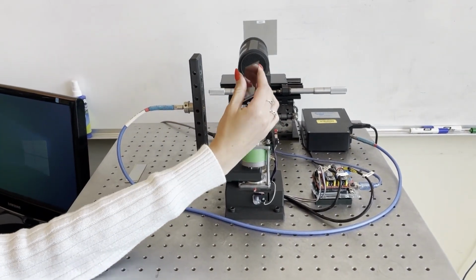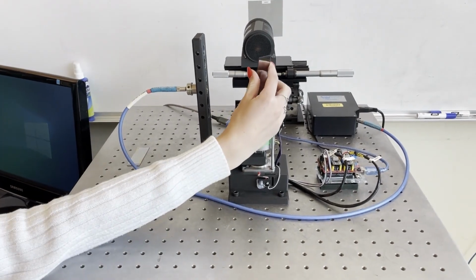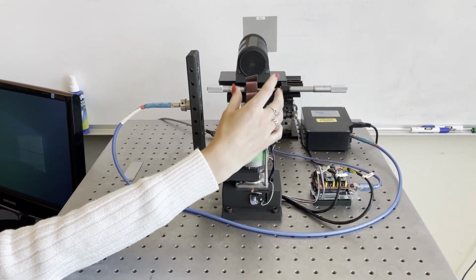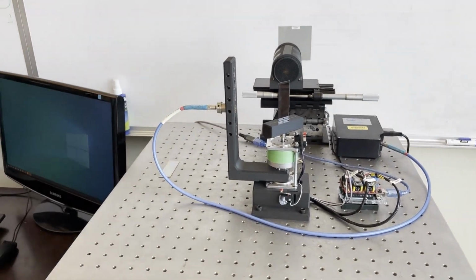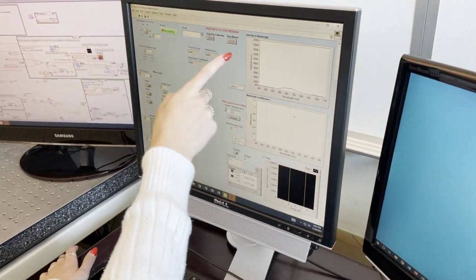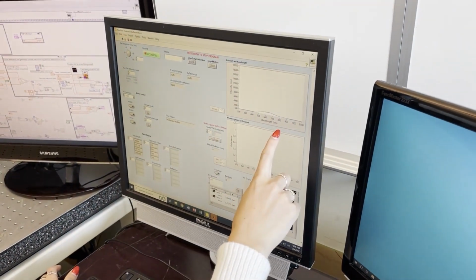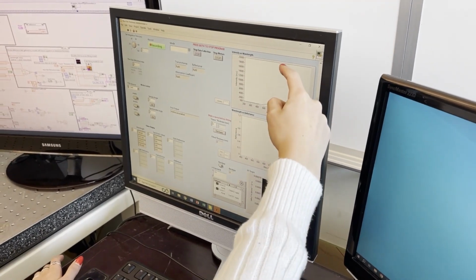The first measurement you're going to want to take involves just the substrate, not the thin film on the substrate. In this case, we're using chrome. So go ahead, put it in your slot, make sure your light is turned on, and then you're going to come over here and hit record. If you look at this intensity versus wavelength graph, you want to see a nice Gaussian shape that goes as far up as it can without clipping.